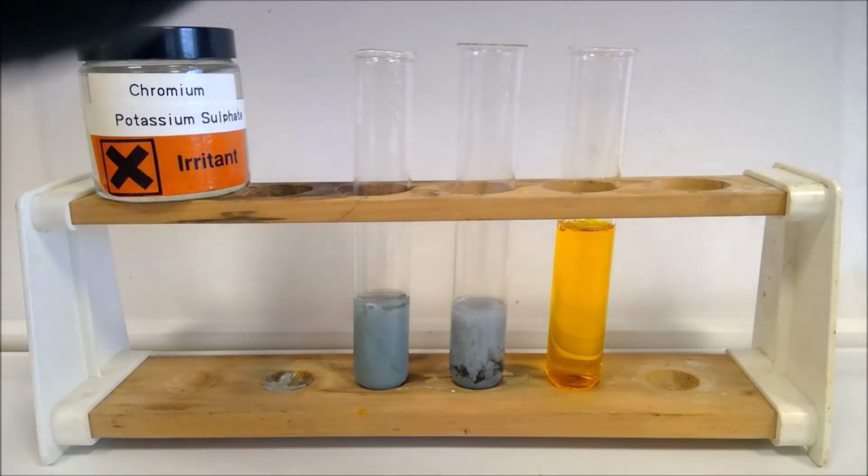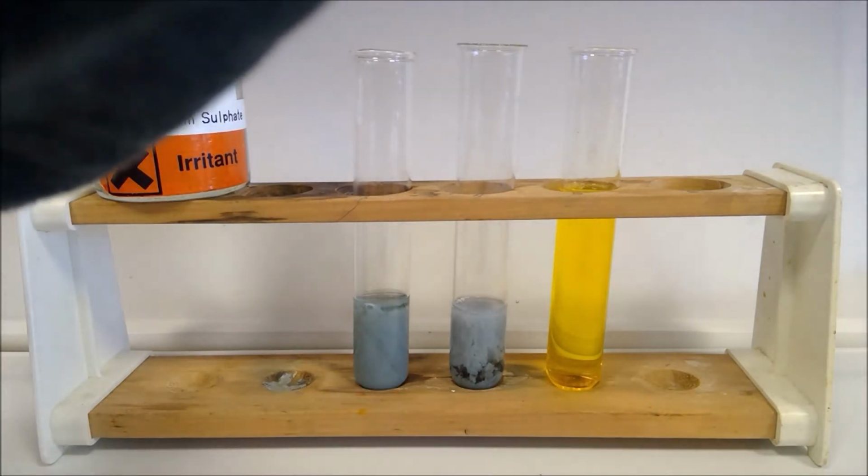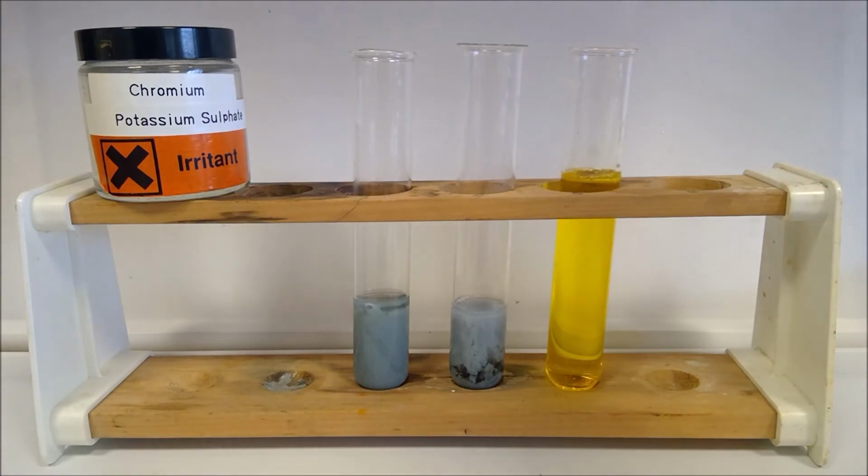I'm going to regret doing the alkaline now. There we go, getting there. I won't do that again, we'll end up with a very full test tube. Okay, you get the idea. All right, so have a think about what we're changing our yellow chromate ions into through that reaction.